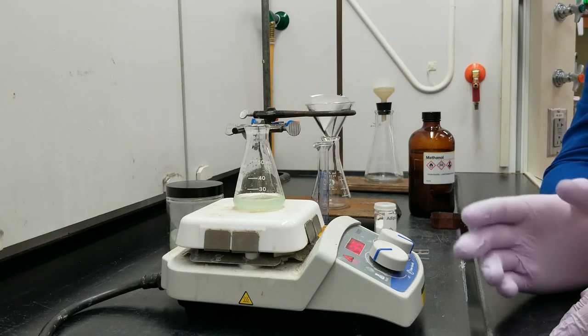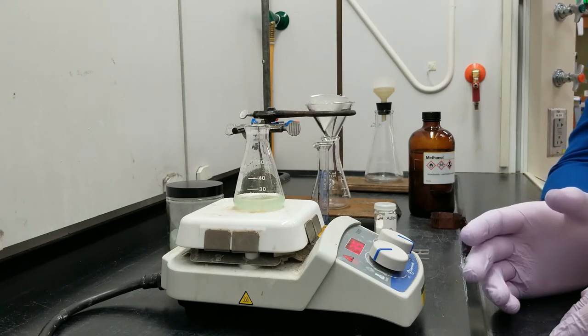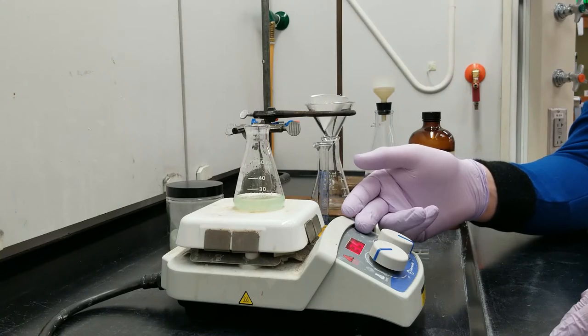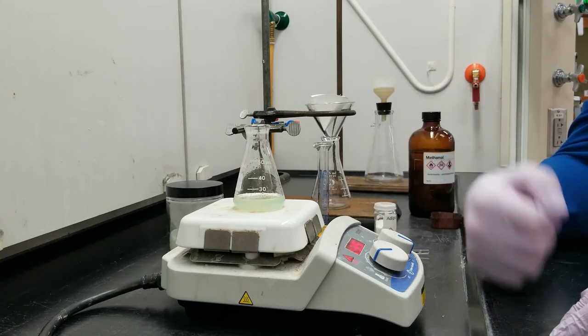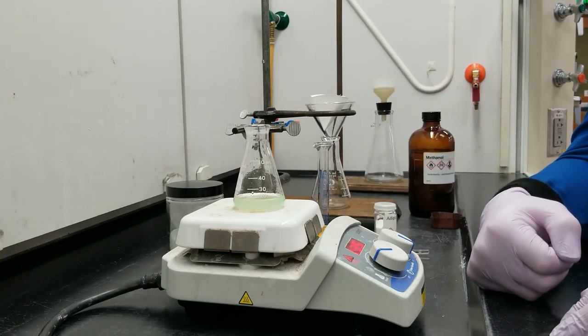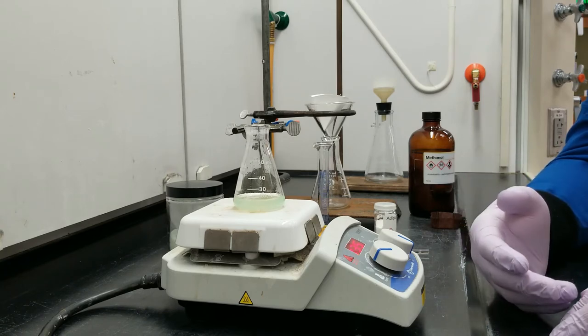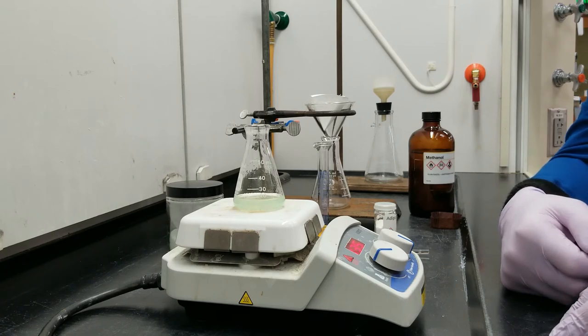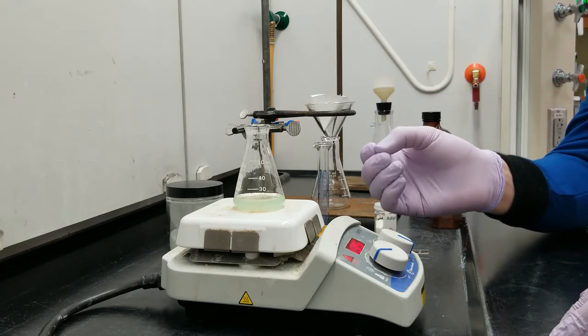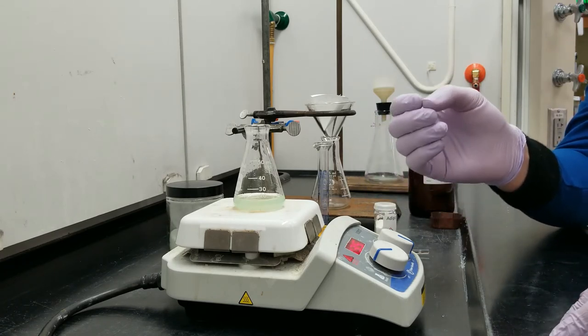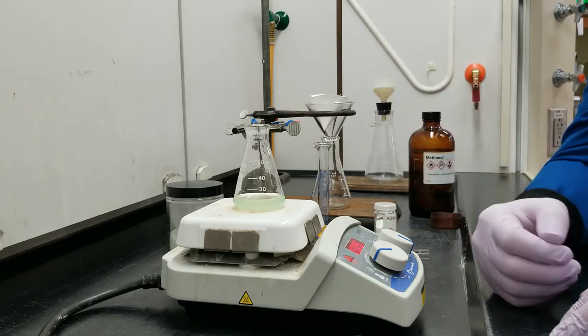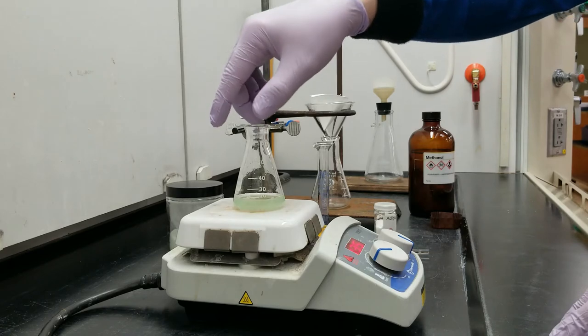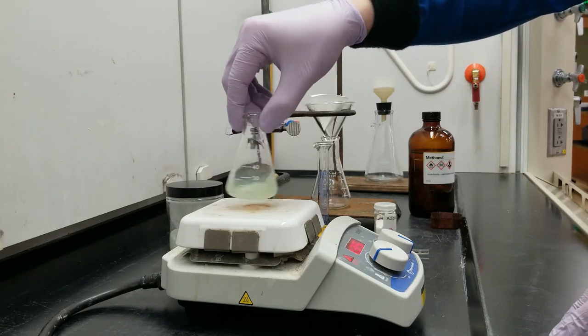You might have noticed how quickly this happened just because I have this hot plate on 135 degrees Celsius which is far above the boiling point of methanol. And on top of that compared to water which you're probably more used to, methanol has a very very low specific heat so it takes less energy to increase the temperature of methanol and it happens much quicker this way. All right I'm super comfy with this reflux.